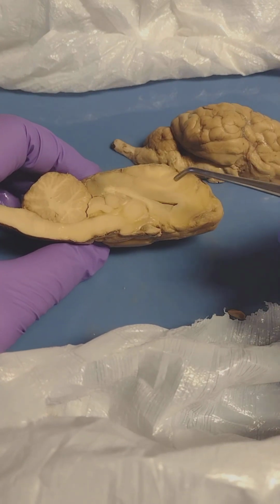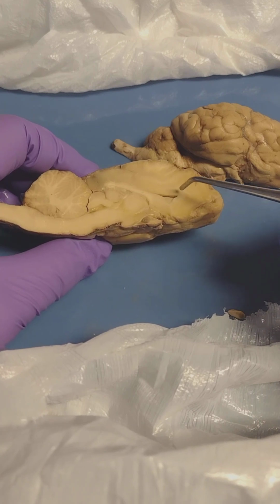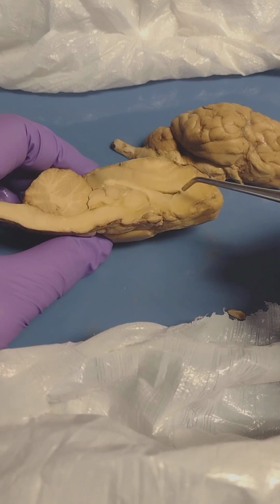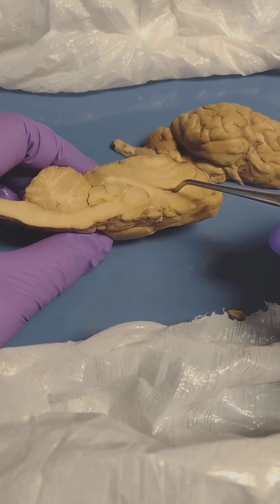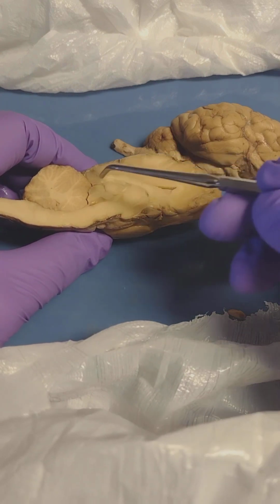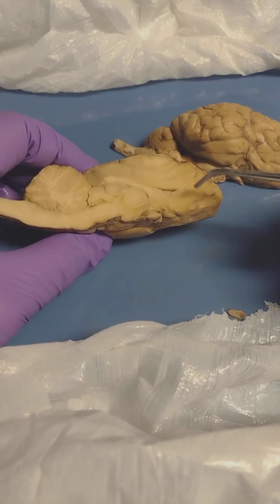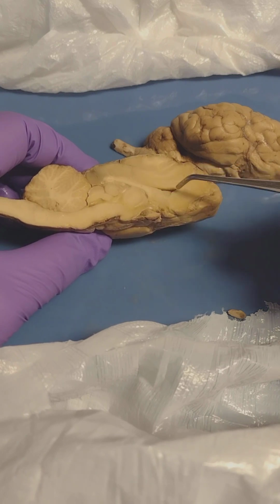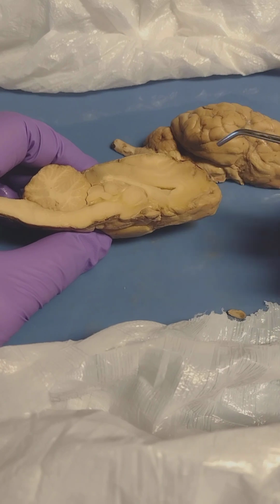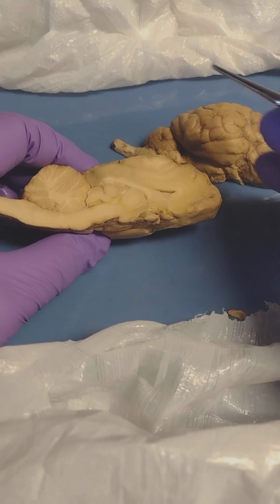It's kind of hard to see here, but right here you're going to have the corpus callosum. It connects the left and right hemispheres respectively. Underneath it, you're going to see a ventricle. There's two lateral ventricles, so you have 1 and 2. You have ventricle 3, and you have ventricle 4. In these ventricles, this is where you find the cerebrospinal fluid. And right here, you can see the choroid plexus, and that is where the spinal fluid is actually created, and it moves through the ventricles.